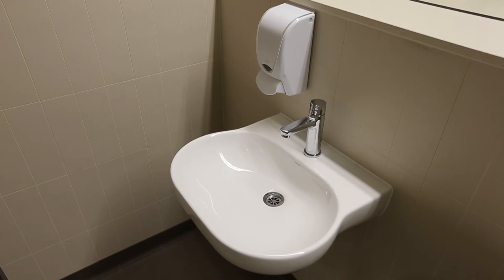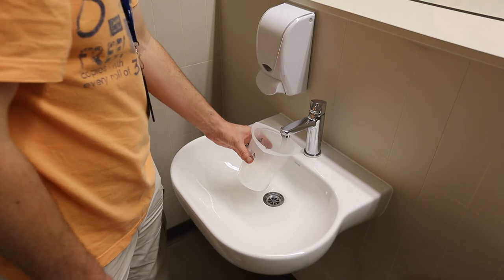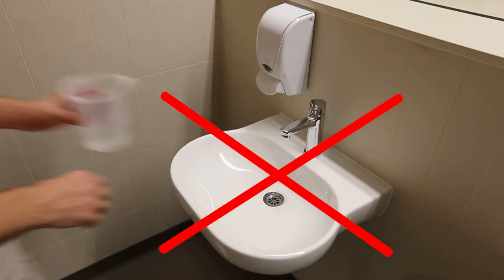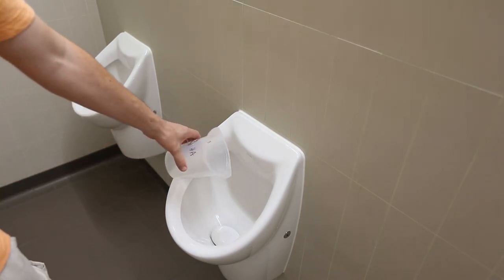Make sure you rinse your beaker before returning to class, but do not under any circumstances pour either urine or the rinsing from the beaker down the sink. Only pour urine or rinsings from your beaker into the toilets.